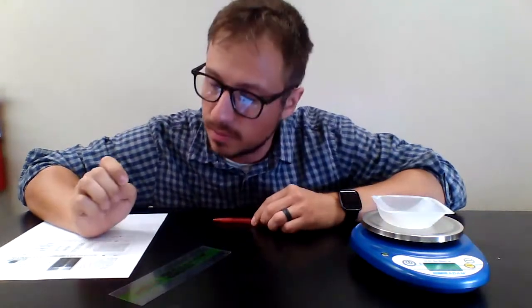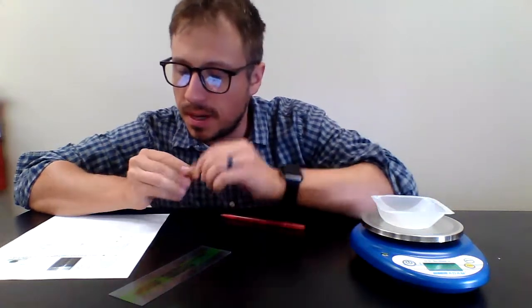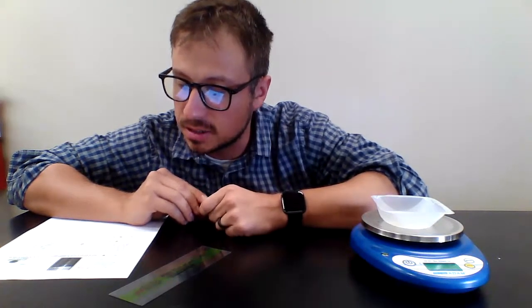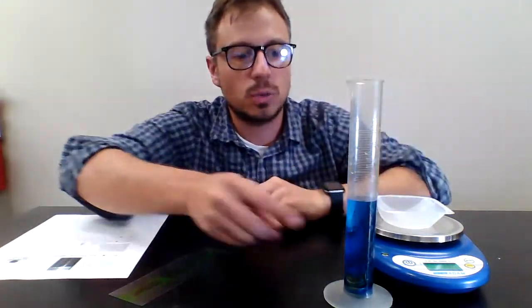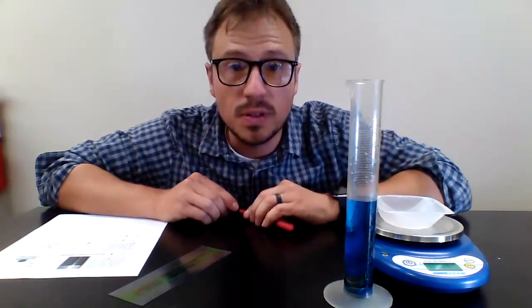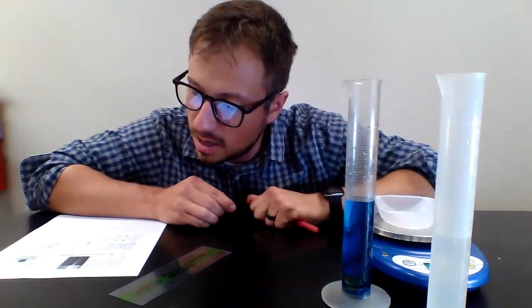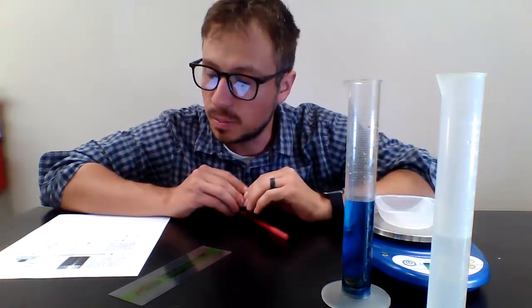So here's the backstory. You are going to determine the density of a single penny. At each table, there's going to be a penny. Measure the mass of the single penny using the digital balance. At the front table, there's a graduated cylinder with 20 pennies in it. So there's also a picture, but I also have this graduated cylinder that I placed 20 pennies at the bottom. The graduated cylinder started with 50 milliliters, just like all of these. Now I dyed it blue so it's easier to see that water level. The graduated cylinder started with 50 milliliters of water before the 20 pennies were placed in it.